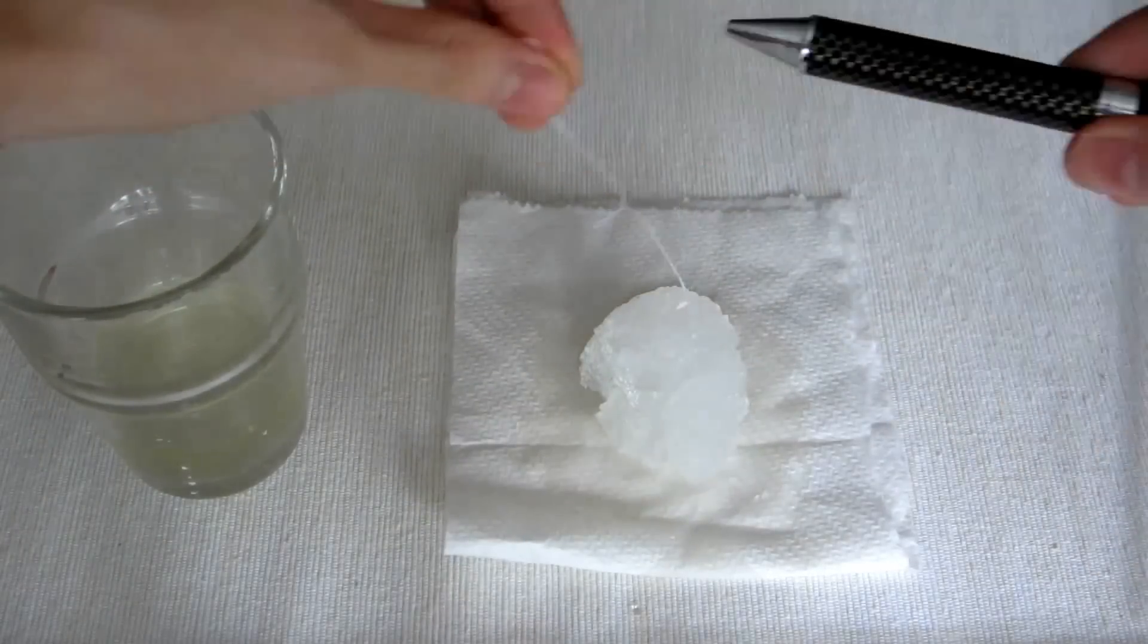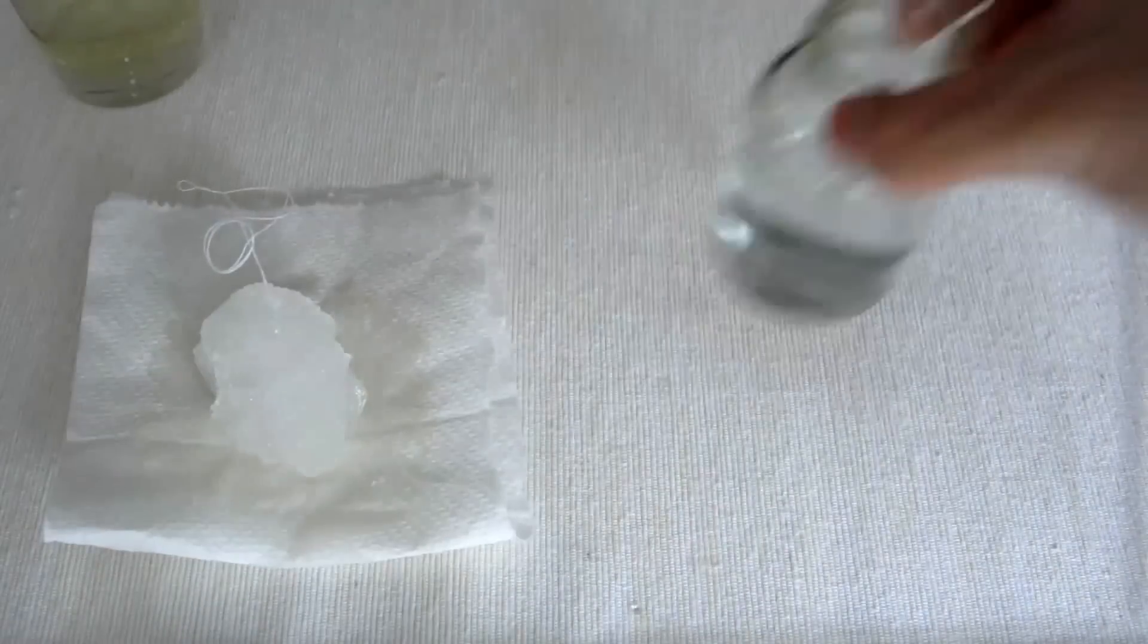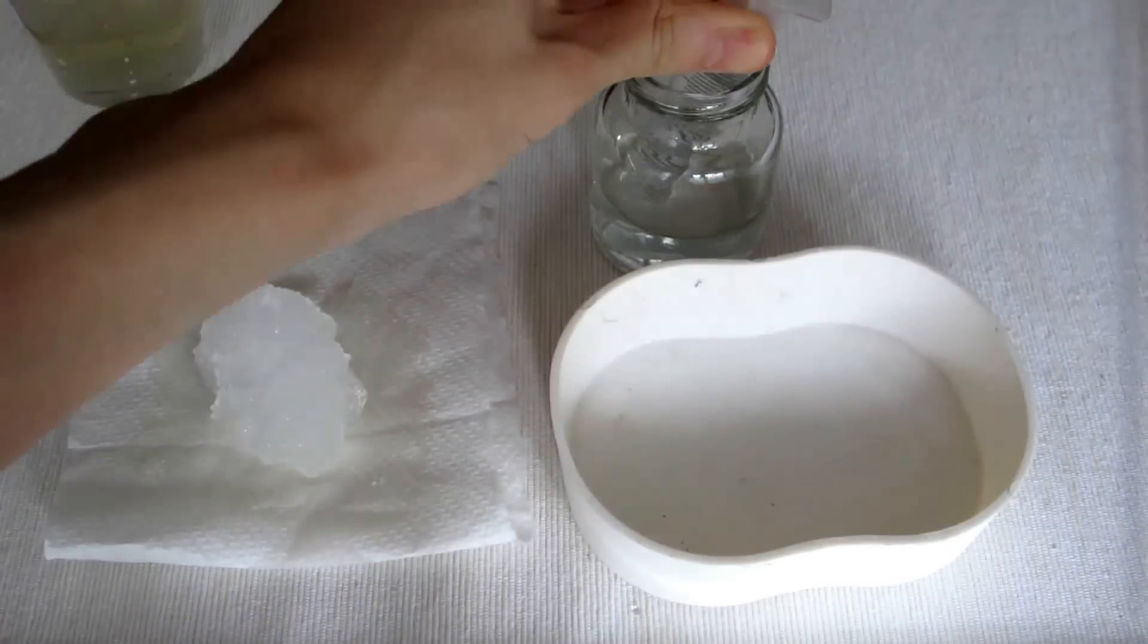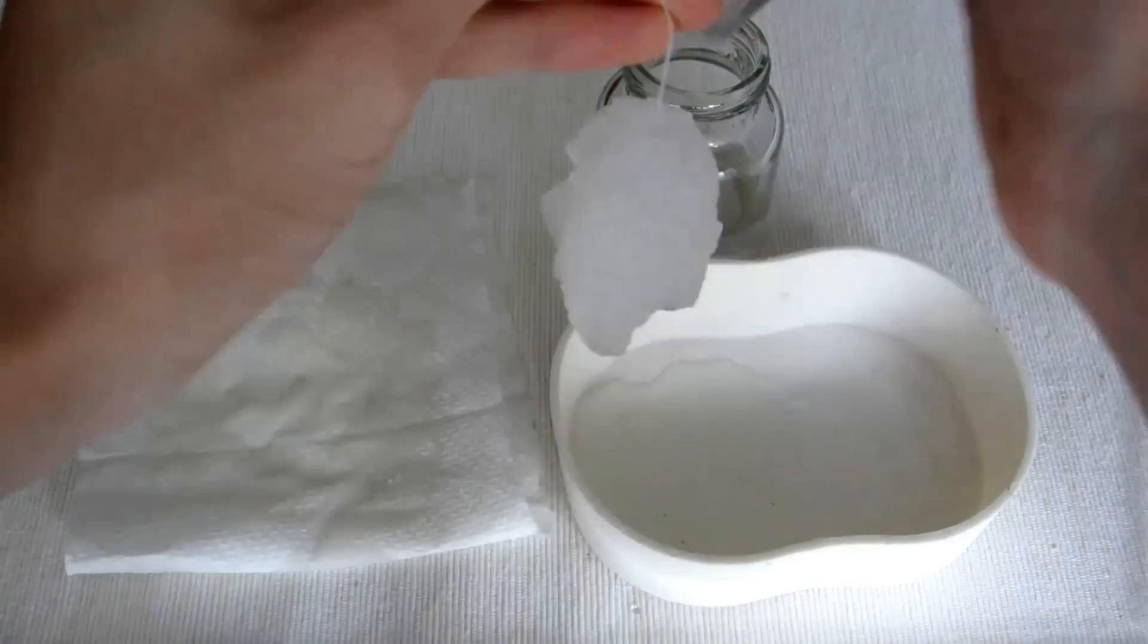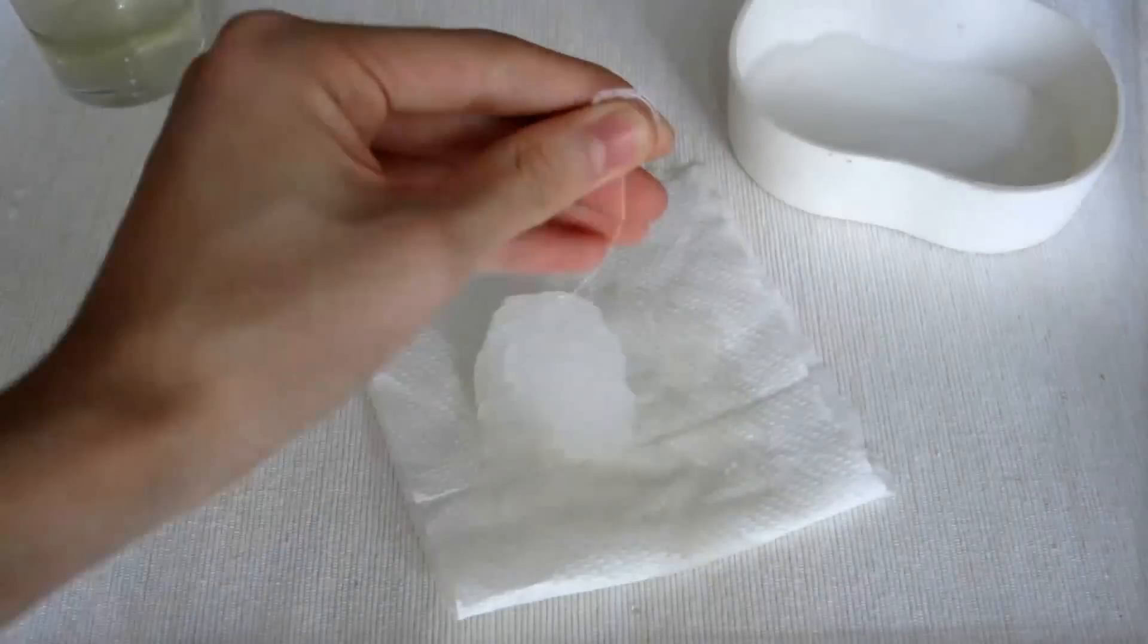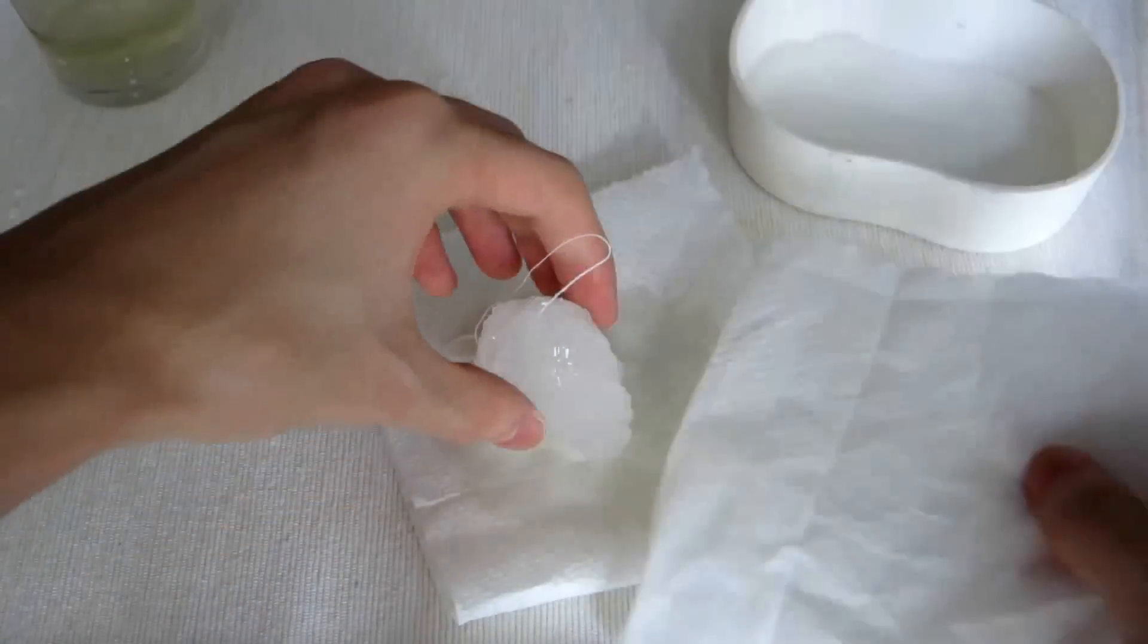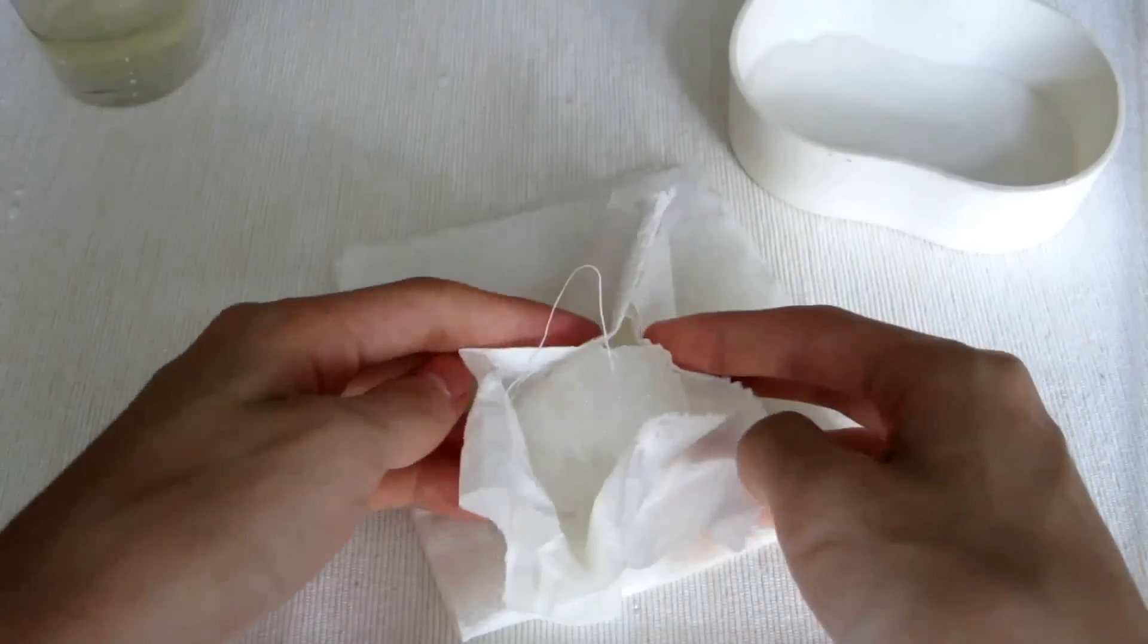Finally, wash the crystal with minimum amount of cold water to remove dust and impurities on the surface. Dry the crystal using filter paper or multifold towel paper.